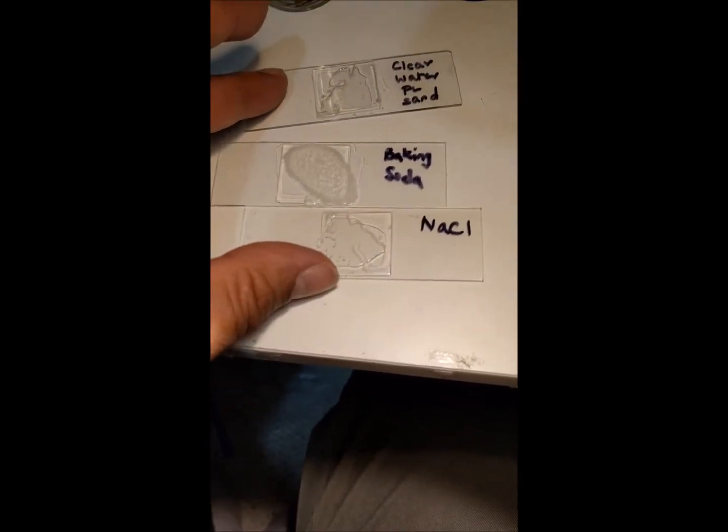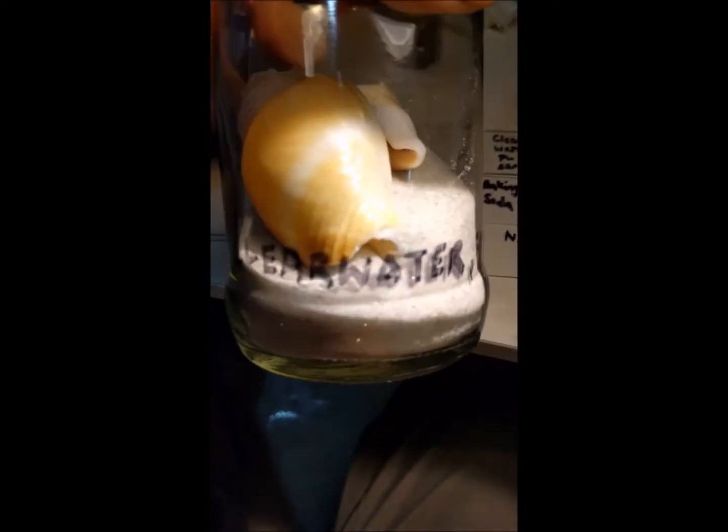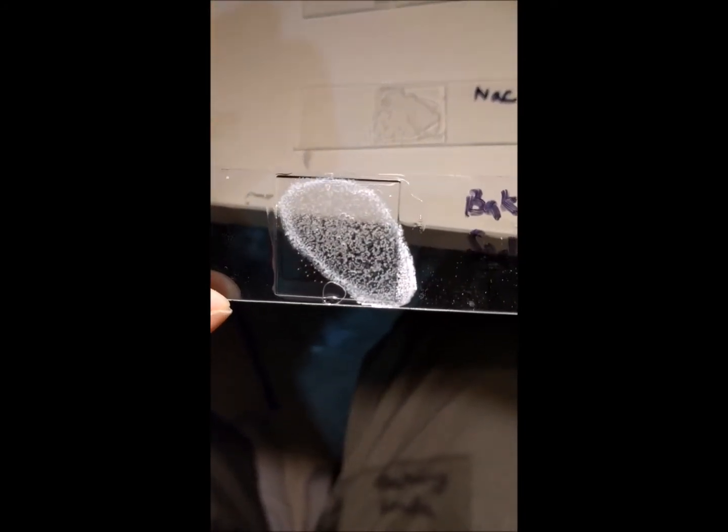For this experiment, I've taken some Clearwater sand — sand that I got from my colleague who'd been to Florida. I also have some baking soda that I re-dissolved and allowed to re-crystallize, and some sodium chloride to see if something similar would happen to it.